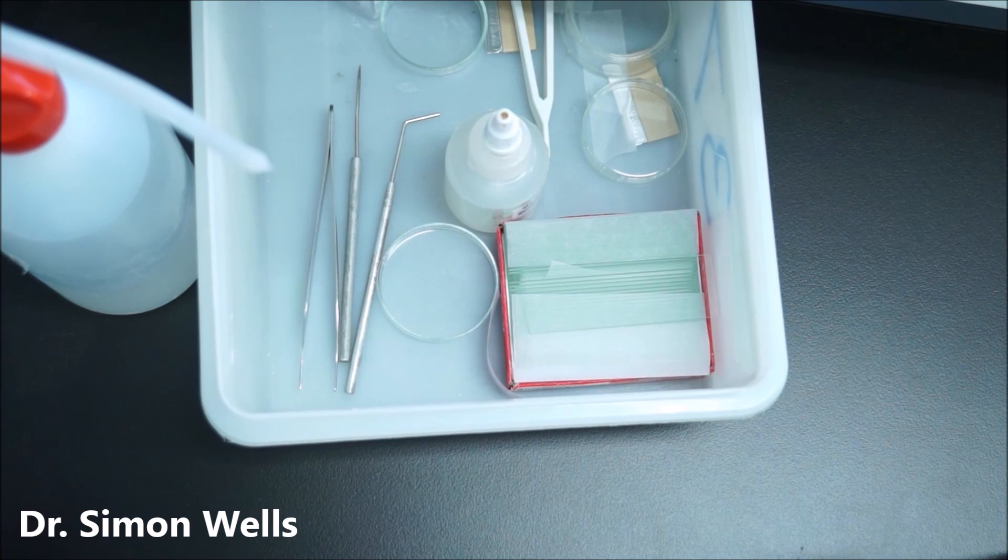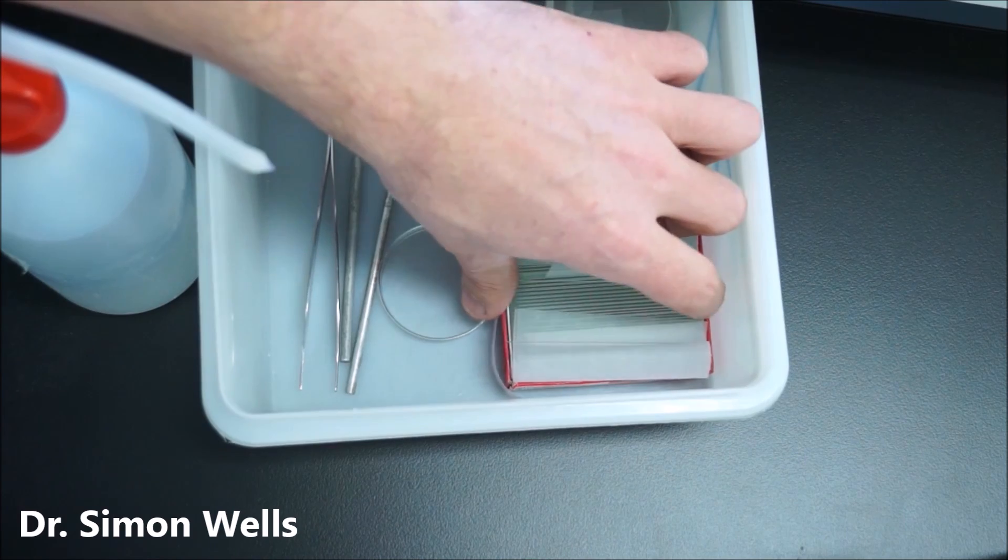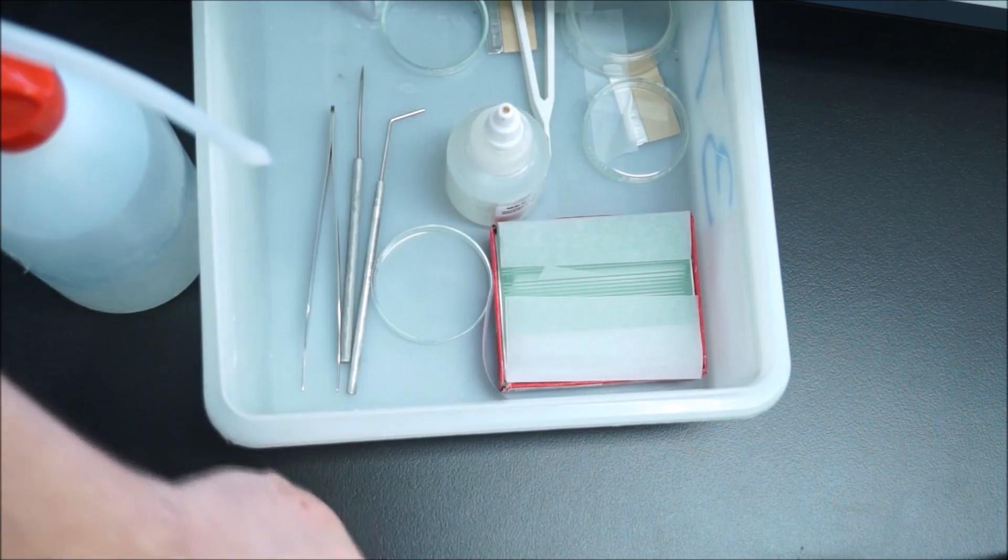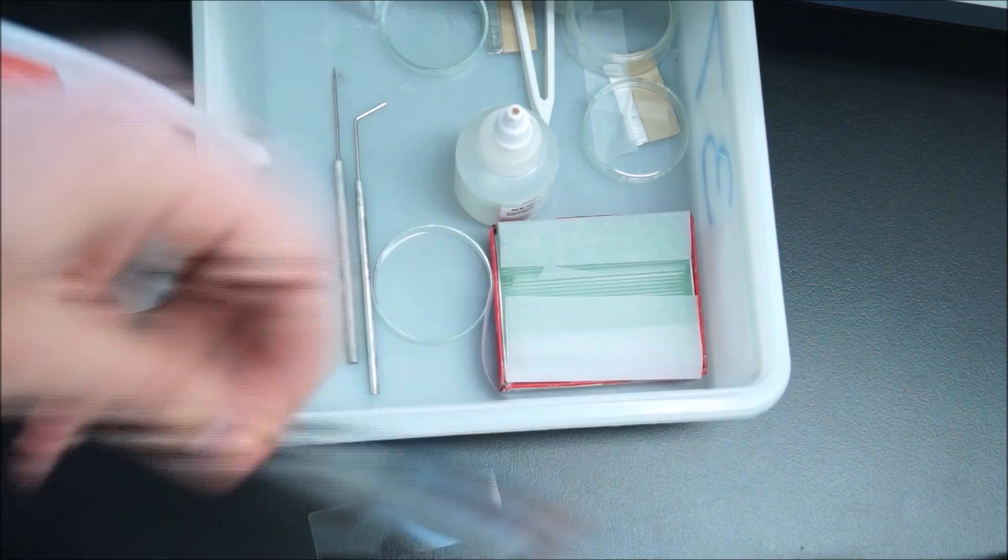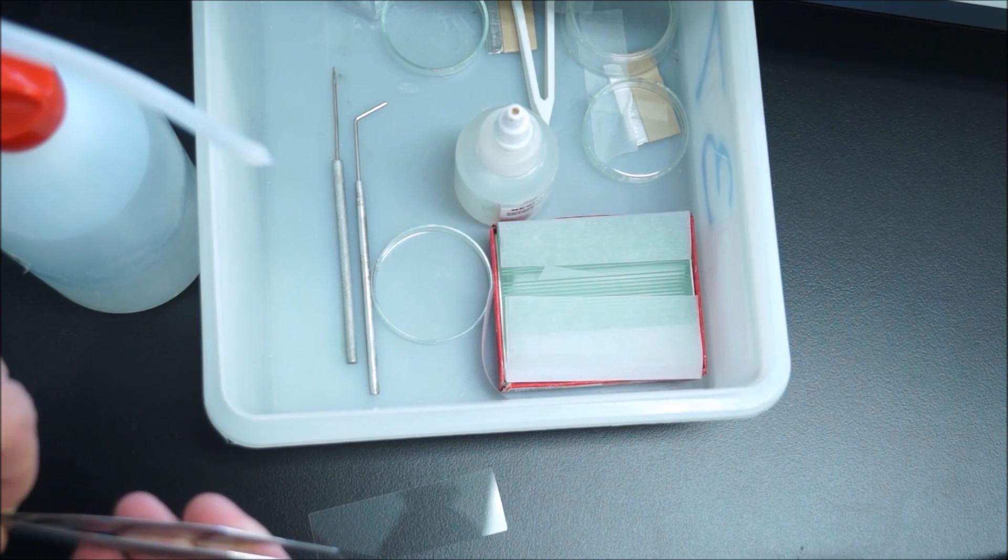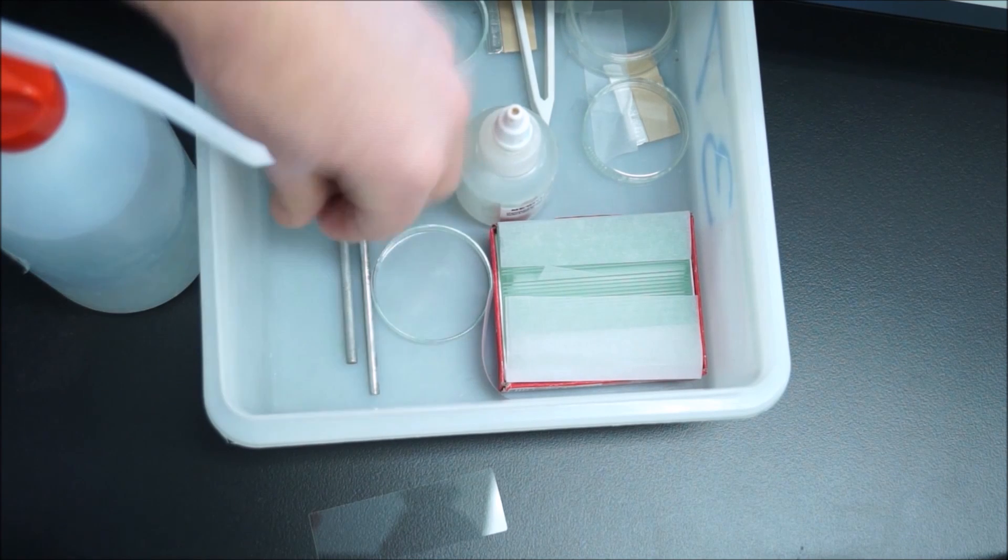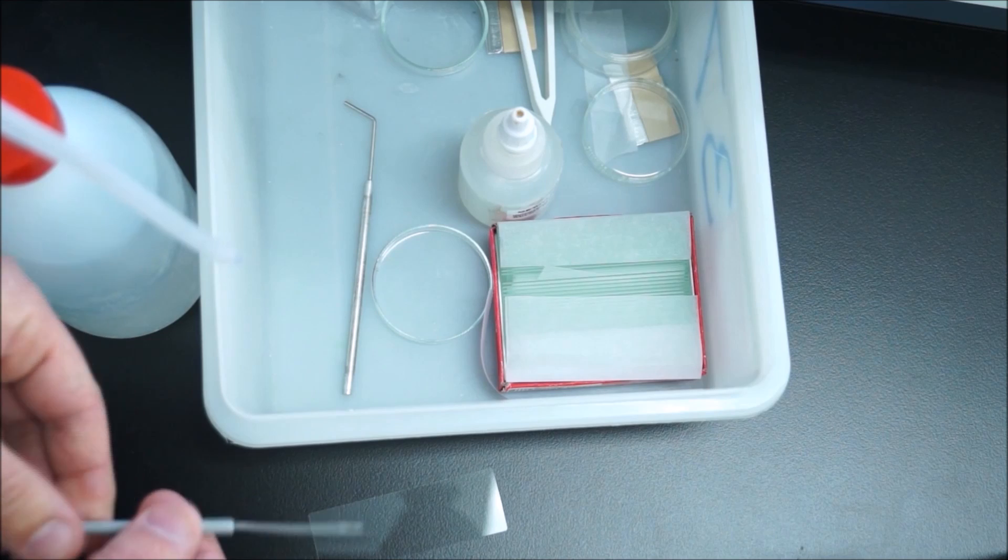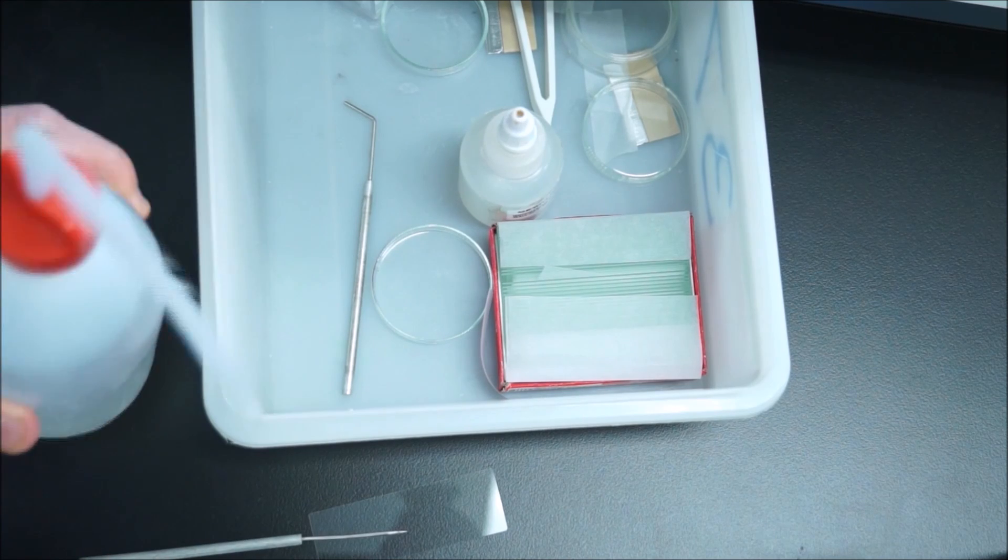This is a short video to show you how to make the Rhizopus fungus slide. What I'd get is a microscope slide and a set of tweezers that has a nice sharp point to them, some other tool that you can probe with, and some water.